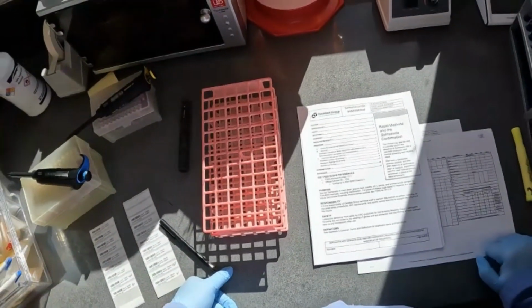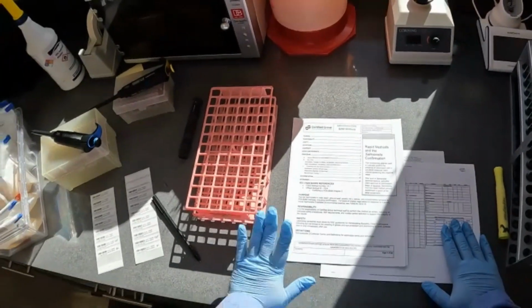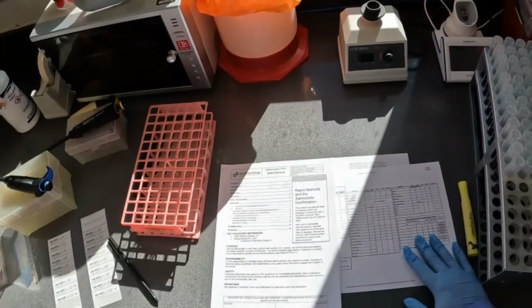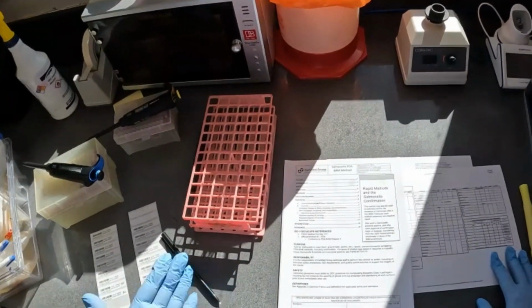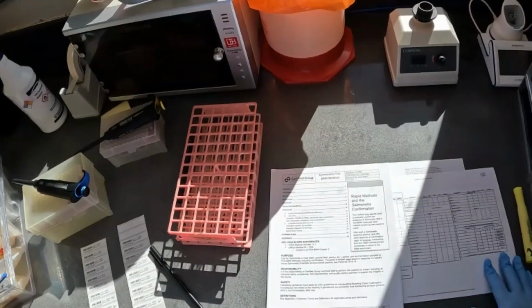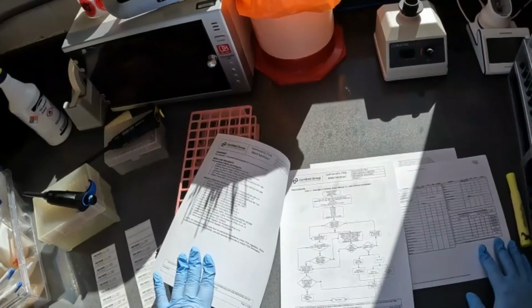We're going to start the Salmonella FDA BAM confirmation method. So I have the SOP here, along with all of my materials and my QC sheet. The Salmonella FDA method can either be submitted as a confirmation only or as a rapid screen and then a confirmation. So you'll have the information for media and reagents listed in the SOP, along with the flowchart that provides an overview of the confirmation as a whole.